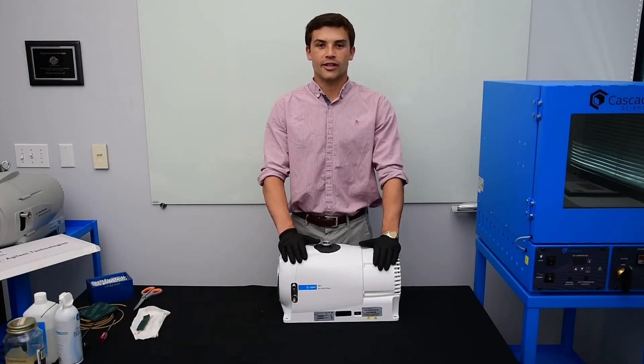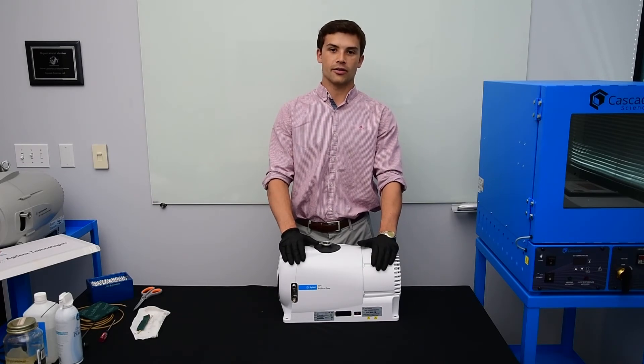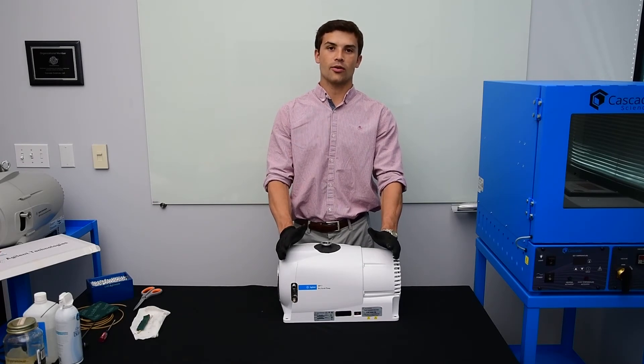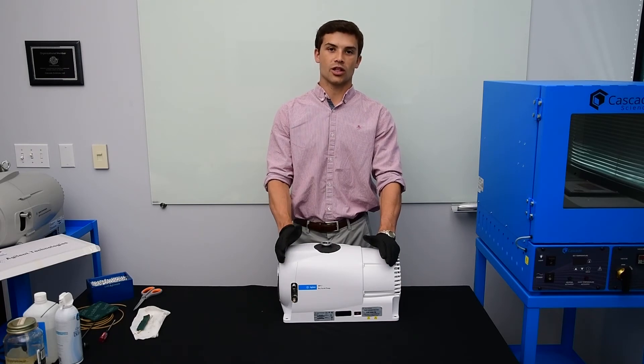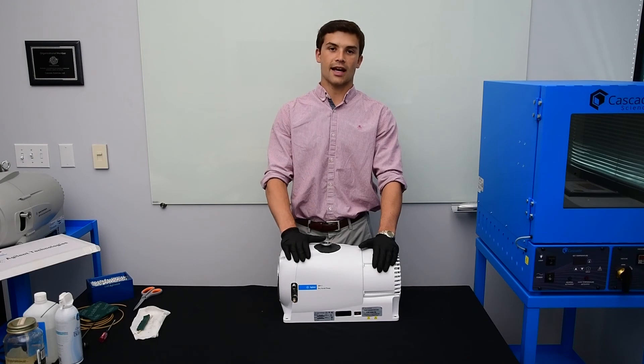We have now finished servicing our IDP7 scroll pump. If you have any questions, please contact Cascade Sciences.